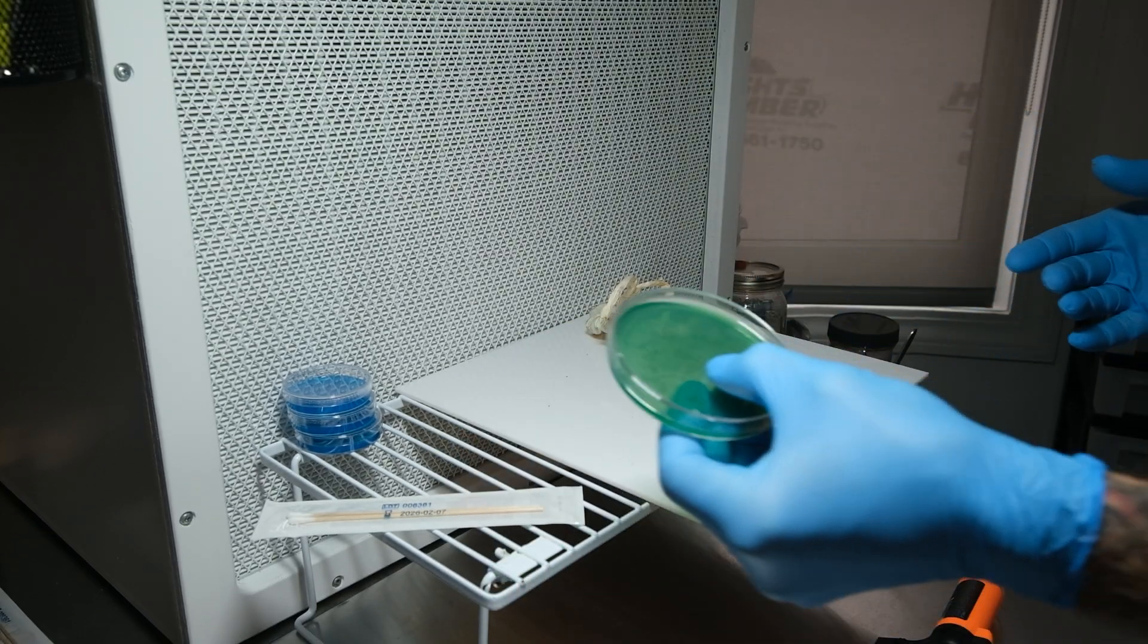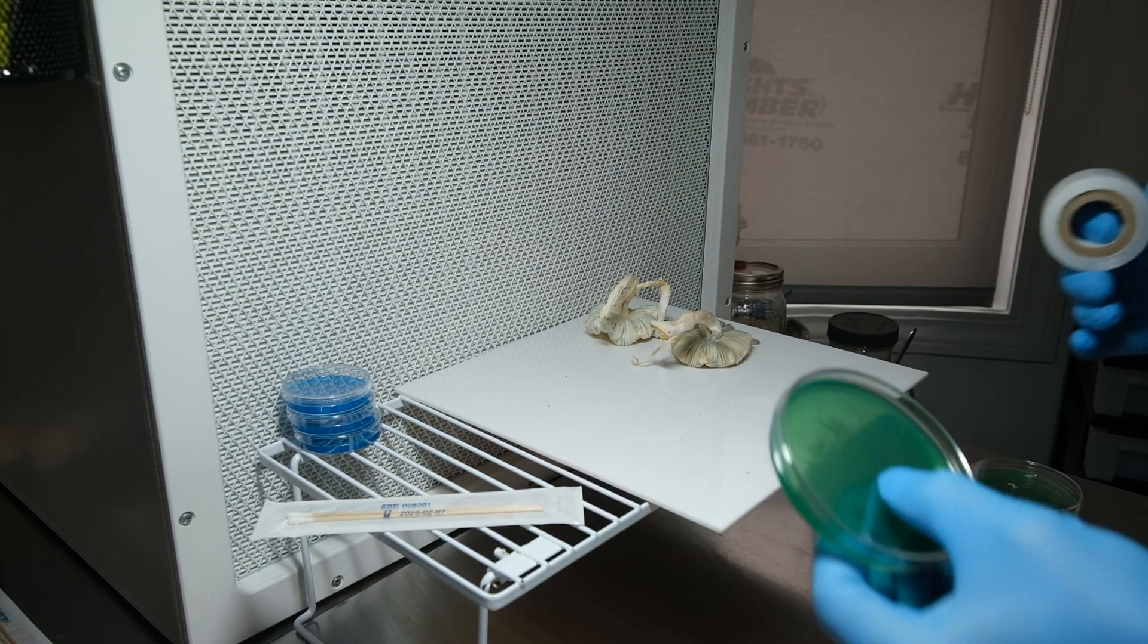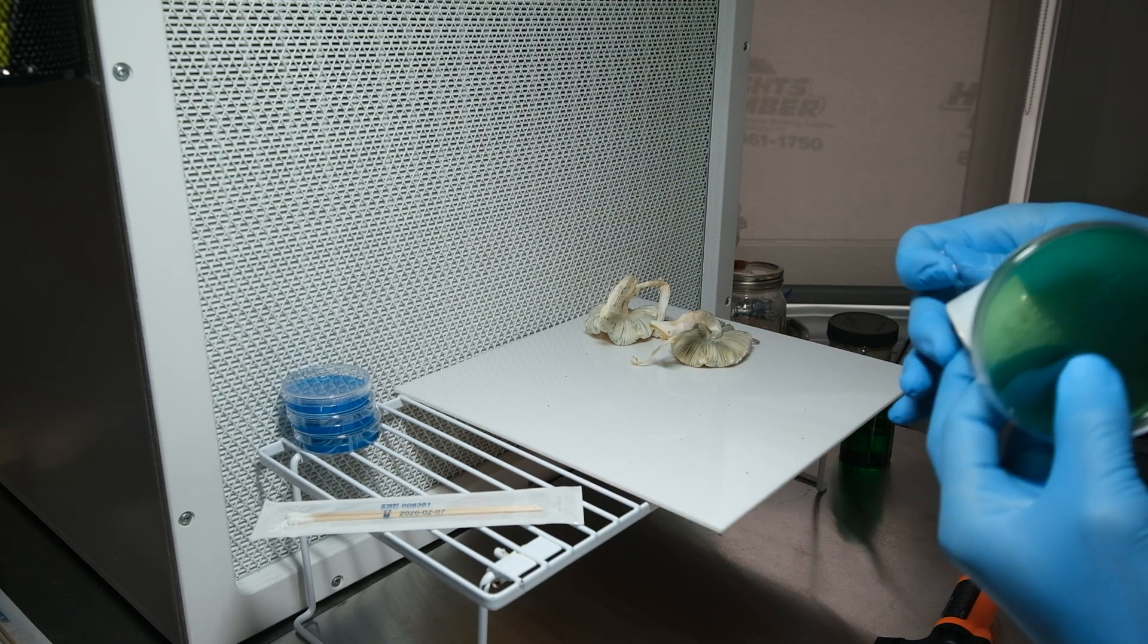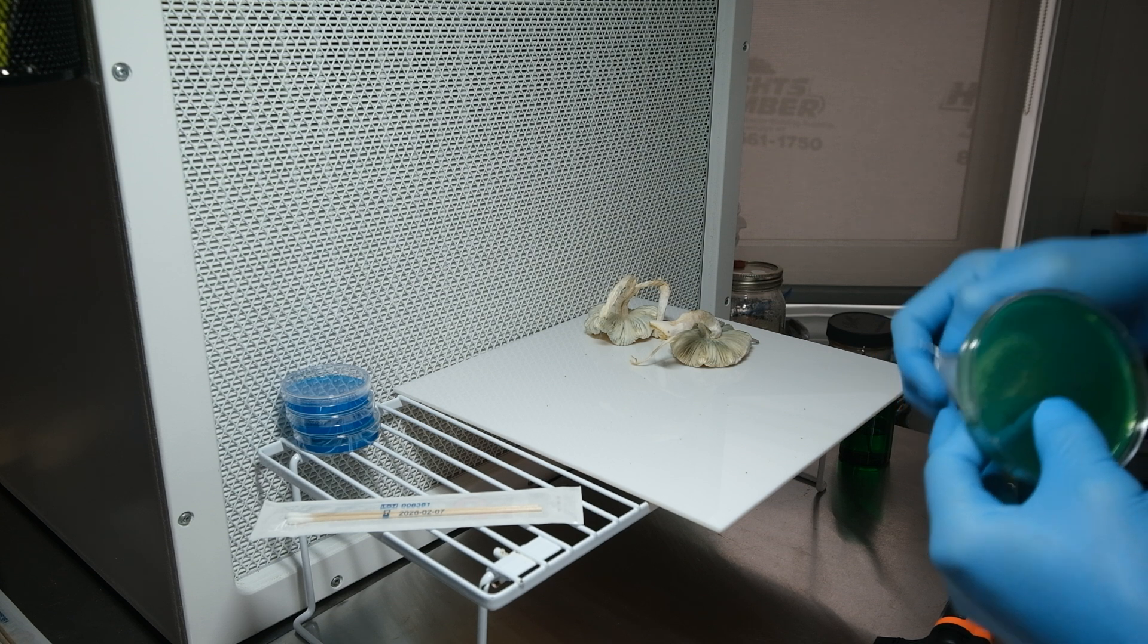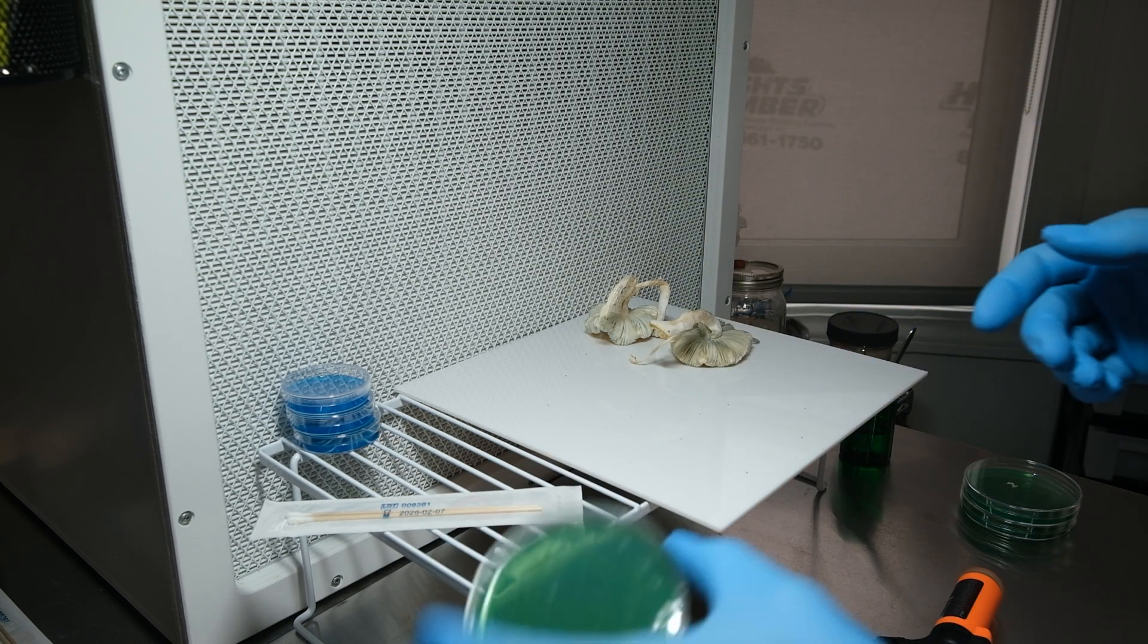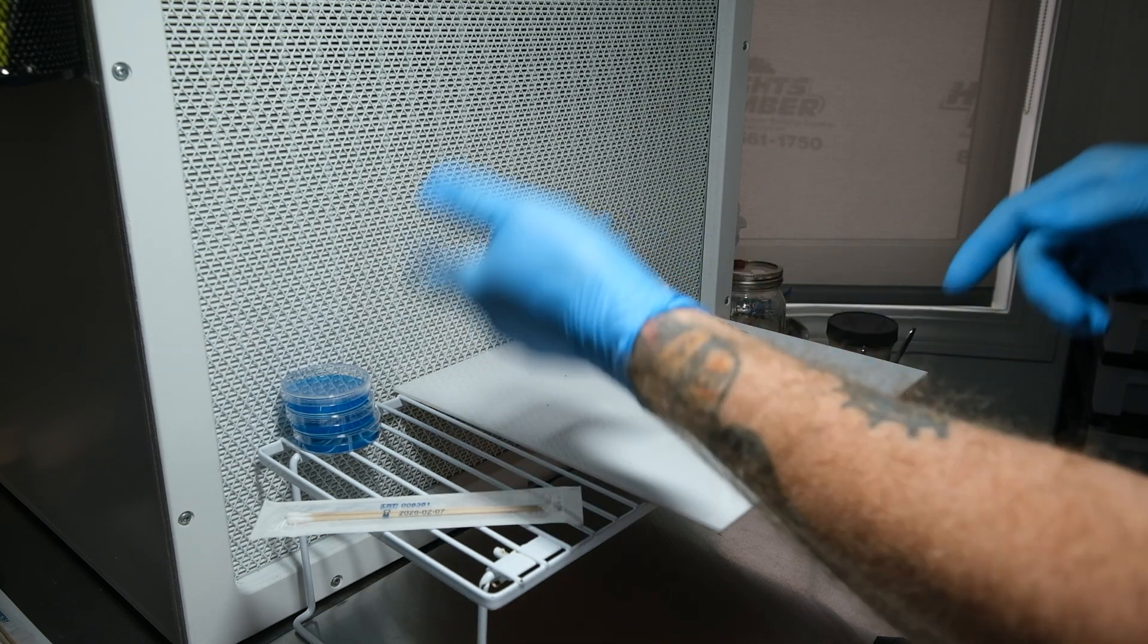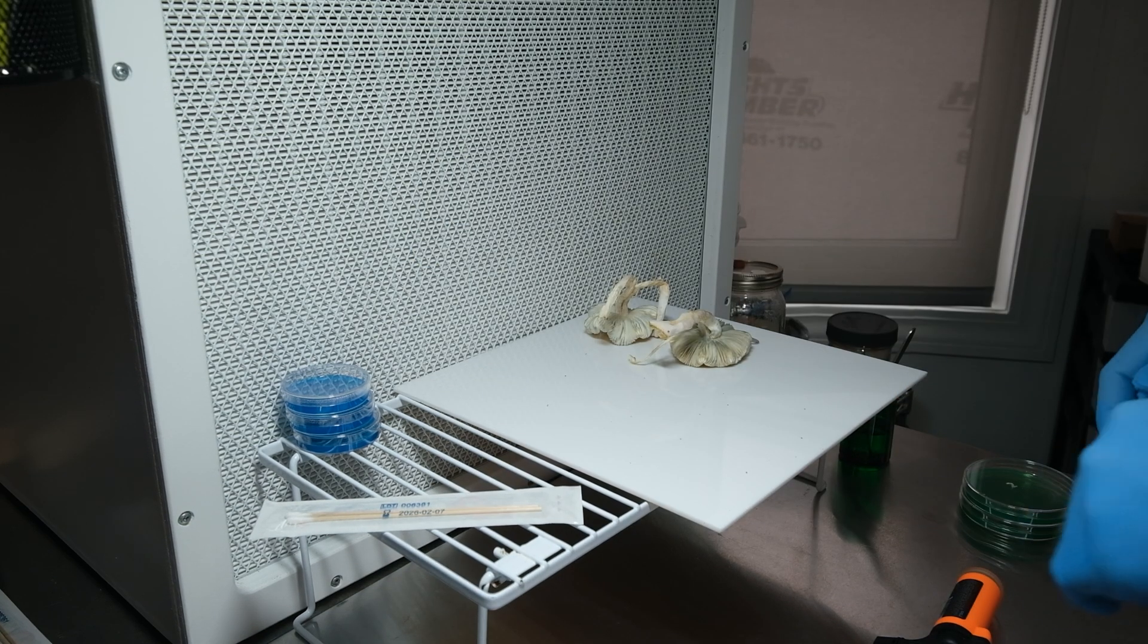And again, these translucent spores you're not going to see them at all on the surface so I've verified on the microscope that they're in there. So I have high hopes for this. I'm gonna wrap it up and we'll give this a week or so and hopefully we'll see some germination. So I'm gonna do that a couple more times on these smaller plates.